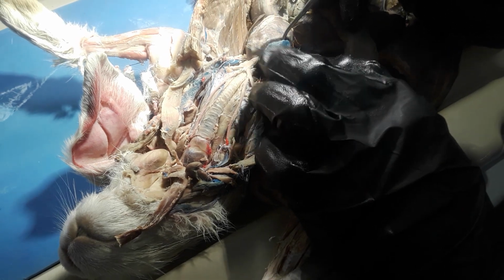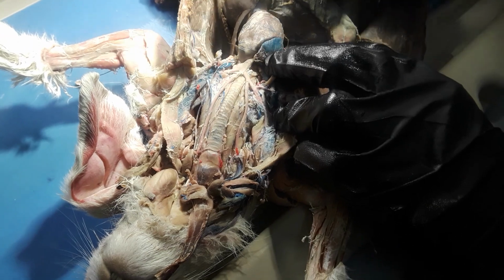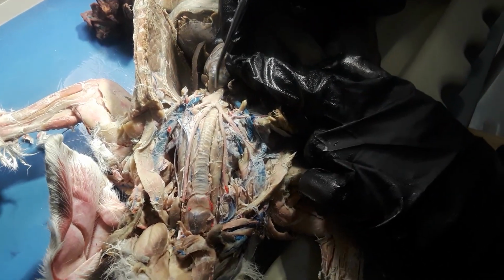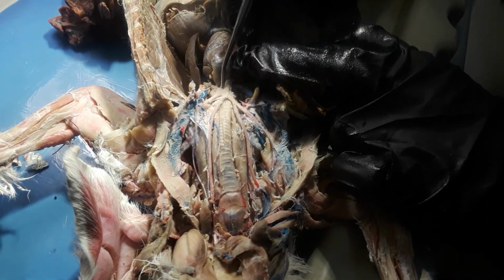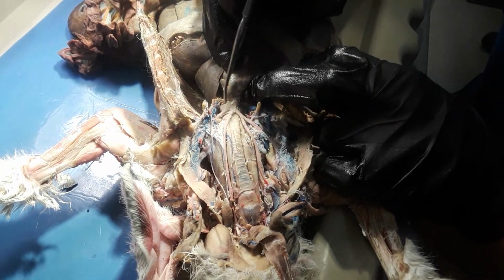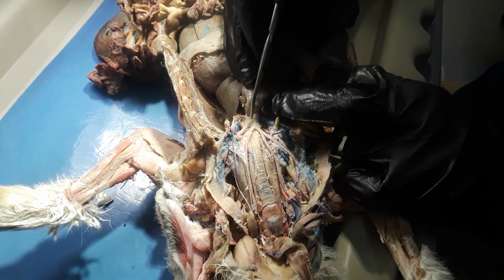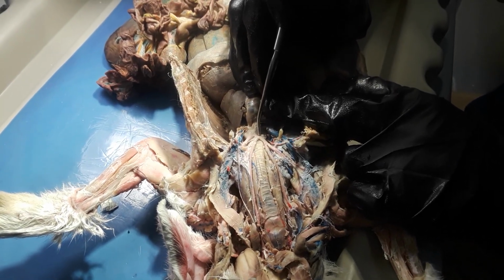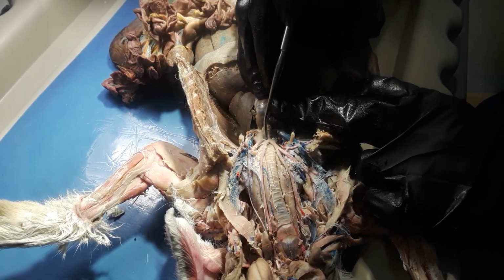Do the rabbit, and we're gonna start with the heart right here, and then we're doing the arteries. So the main artery coming out of the heart will be the aorta, and then as you arch this a little bit, it'll be the aortic arch, and then this little section right here will be the Brachiocephalic Artery.